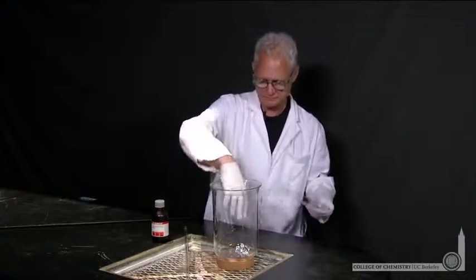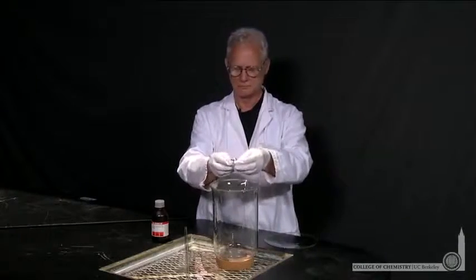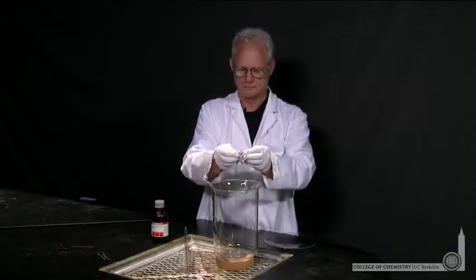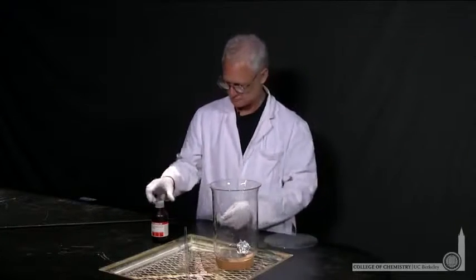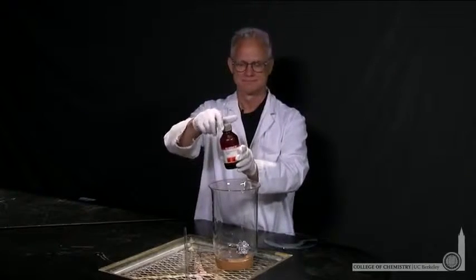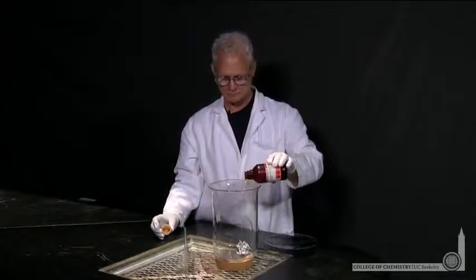I'm in a lab with Lonnie, where he has a piece of aluminum foil. He's going to shake and manipulate that to increase the surface area, and then he's going to add some brown bromine liquid. Elemental bromine is a liquid, and he'll pour that in — you'll see the brown color.